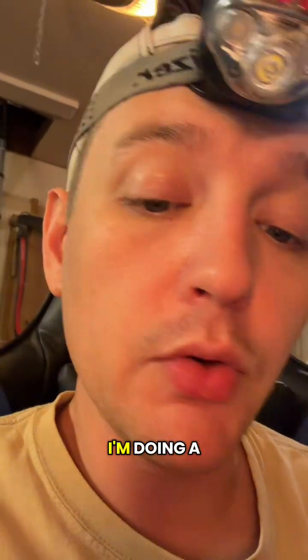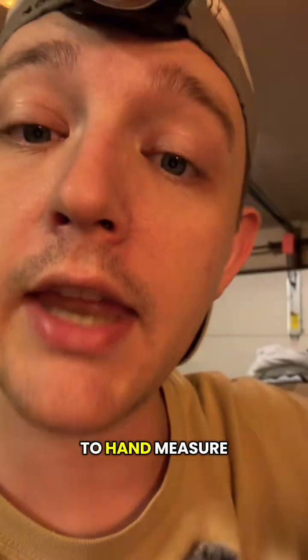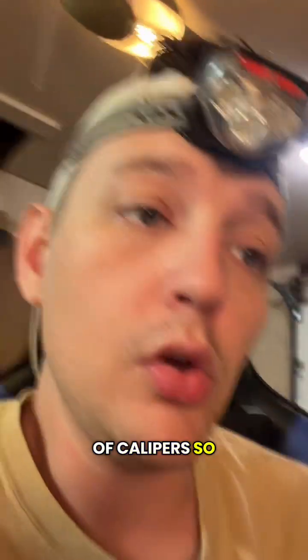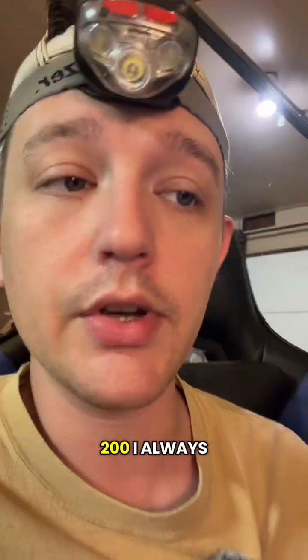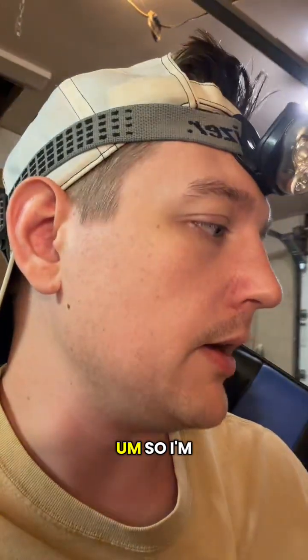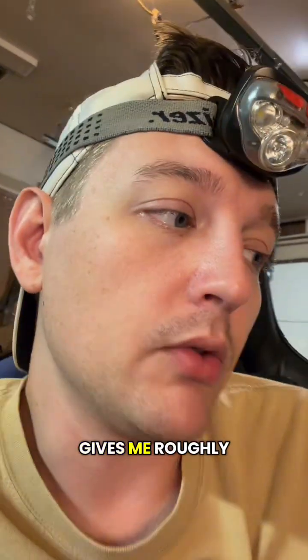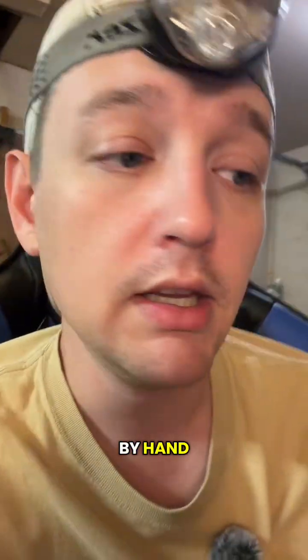The reason why I'm doing a subsample is because it would take me so long to hand measure all the mussels in that sieve with a pair of calipers. So if I know there's going to be more than 200 or at least 200, I always do a subsample just because it saves me time and it doesn't affect the average. I'm measuring shell length, and doing a subsample gives me roughly the same average shell length as measuring them all by hand. So yeah, it just saves me time.